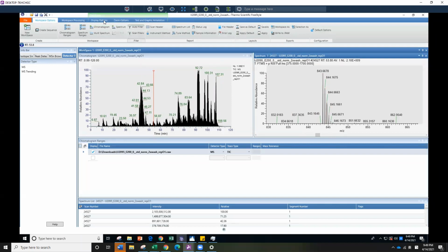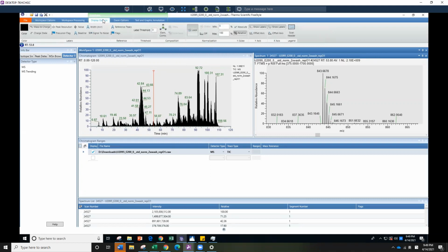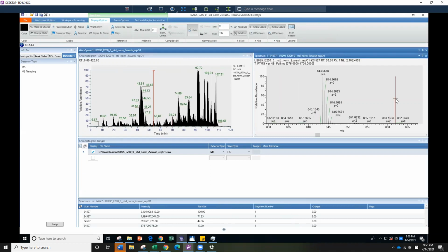If you go to display options and click on spectrum, it's highlighted in blue, while the others are light blue. In the spectrum display options, you can select its charge state. So it is a charge 2. You can also change it to absolute intensity. That's something I like to do, and you can continue to walk through.